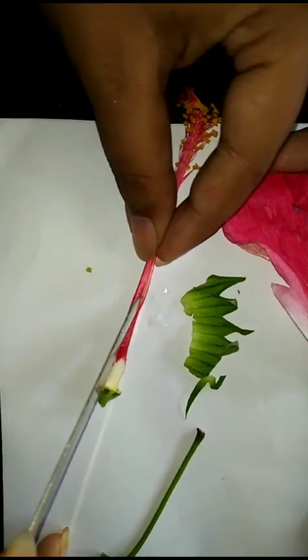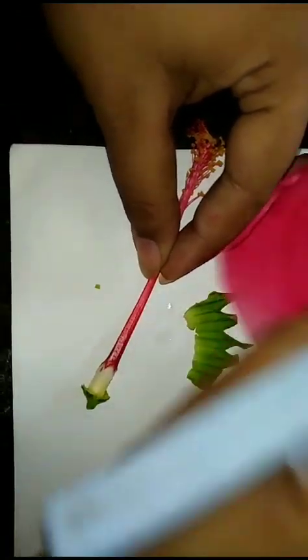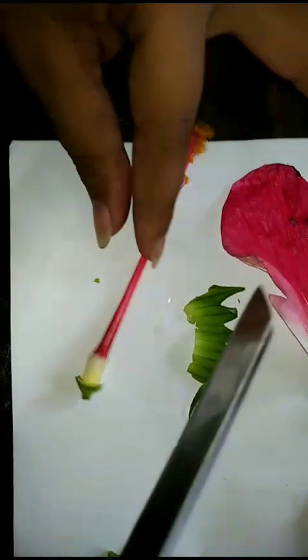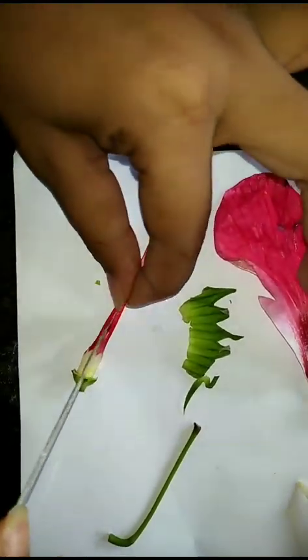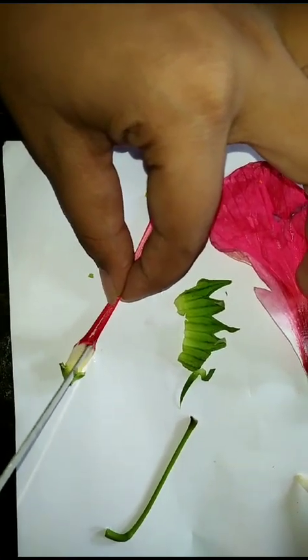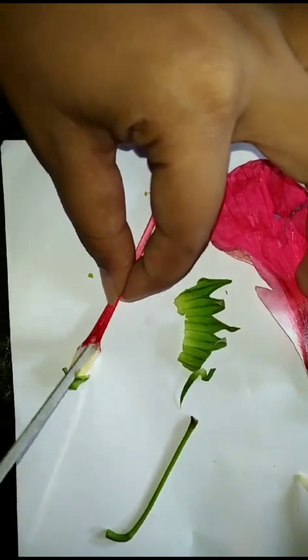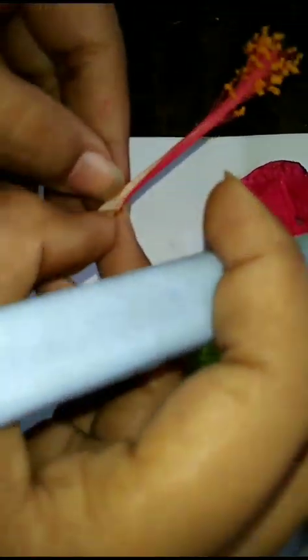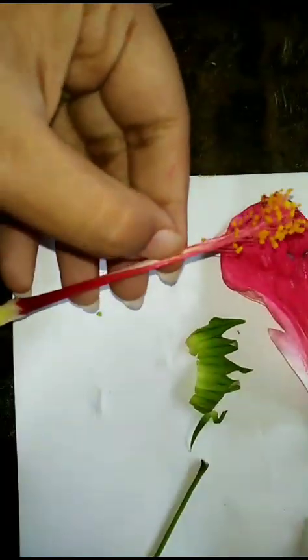It is advised to do this dissection under the supervision of a guardian or any elder person. Now we are going to separate the androecium and gynoecium. We should not tear up this head, so do it carefully.